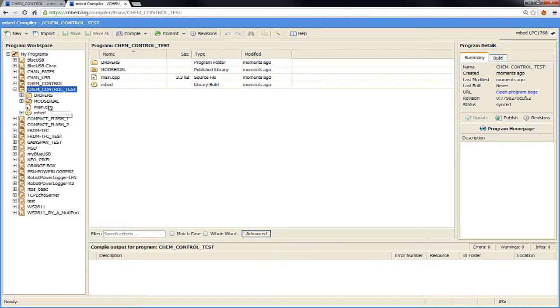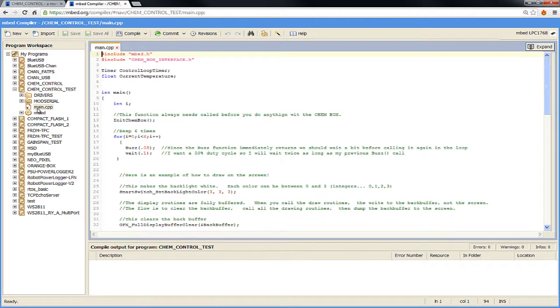Now don't worry, as you're editing, if you have a test one, it doesn't make a change on the website. You actually have to go through a process to get changes on the website, and we can work through that another time. So what I'm going to do now is step you through the source code and how you upload it. So the first thing we're going to do is I'm going to click on main.cpp. This is a basic template that's going to be there for all the demonstrations I'm going to show you. So there's enough here where someone who has a little bit of programming skill could look at it and figure it out.